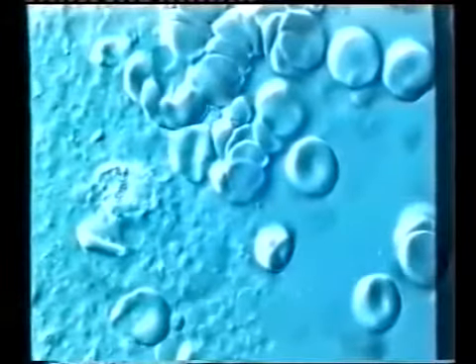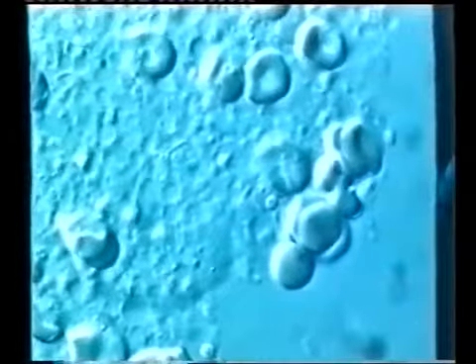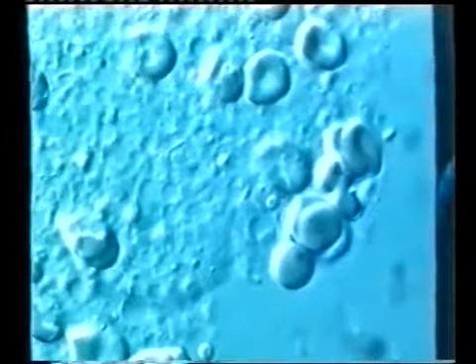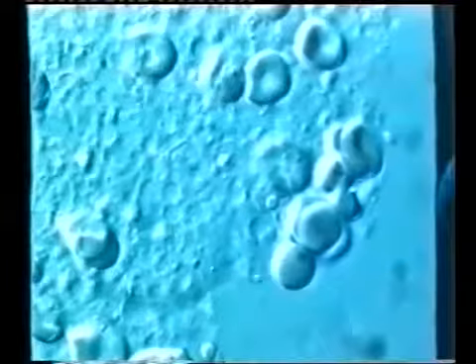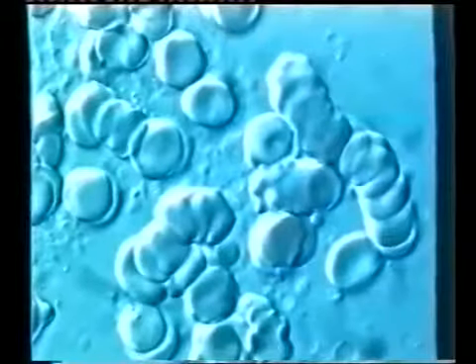In this blood sample, there are 3 to 4 such structures on the slide, and it is interesting that these structures in most cases are found in the first received blood drop, but they will become fewer in the following drops from the same hole in the finger pad.